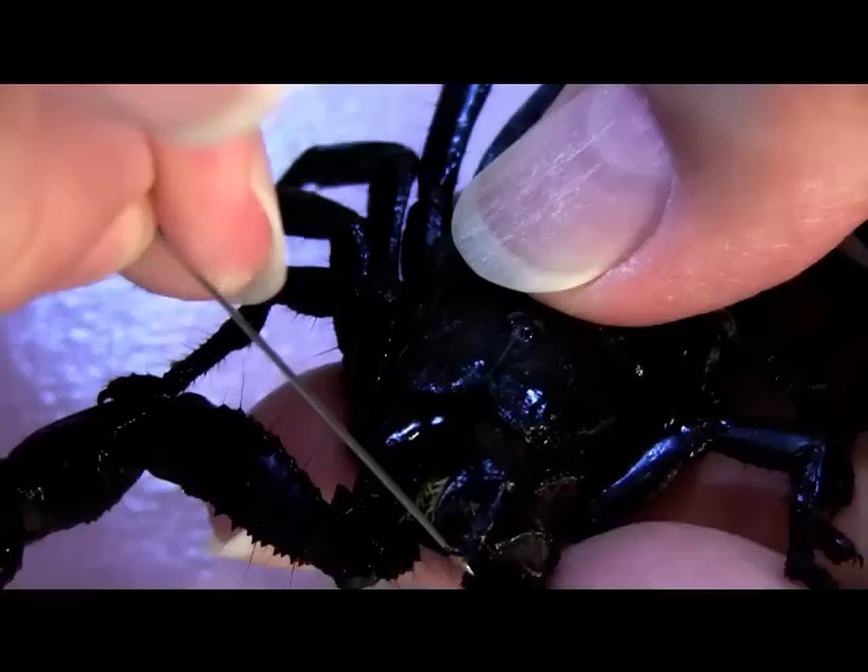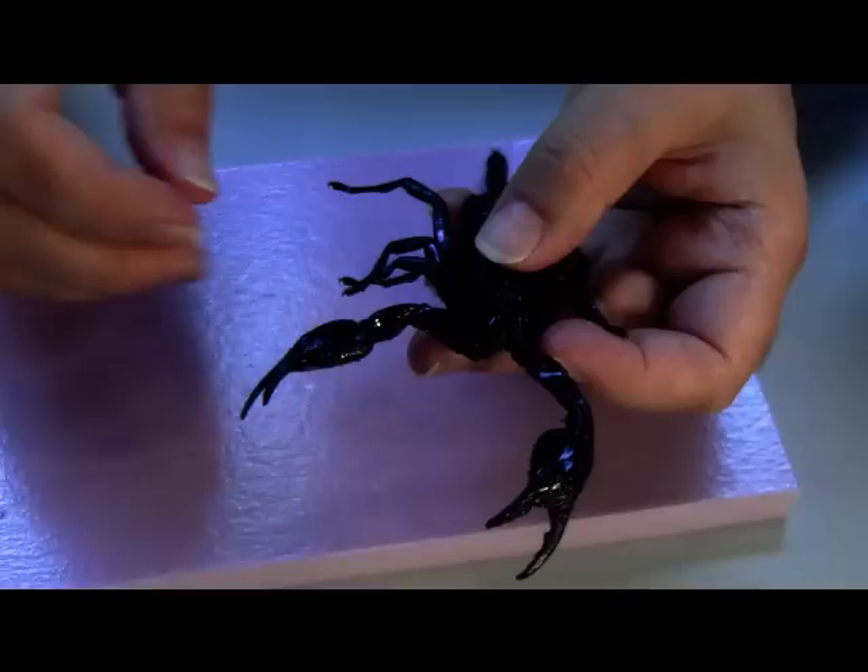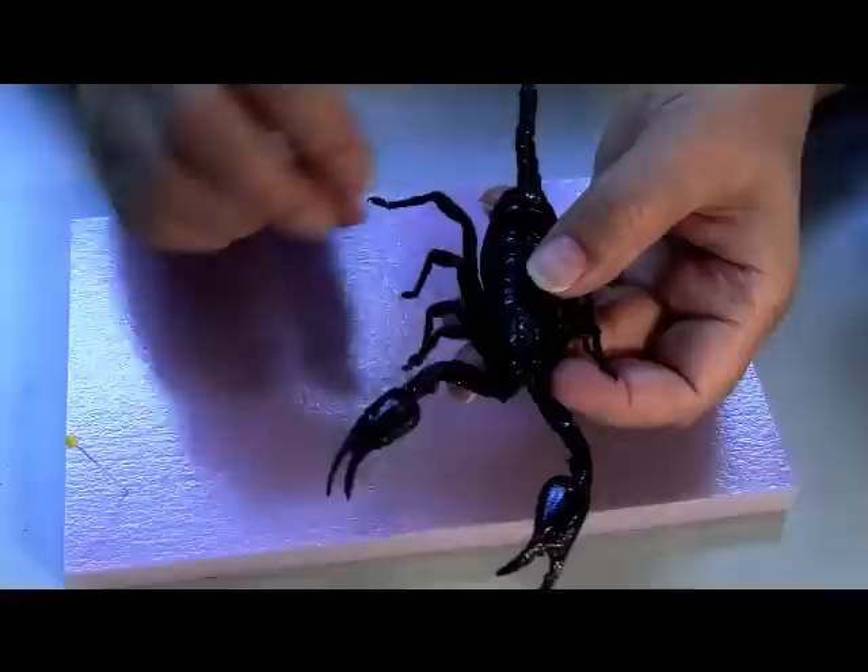You can even open those up and he'll be ready to go. Once you pin him in and open these up, you'll be able to see it better and work with it. For the legs, all you're going to do is twist them up just a little bit.